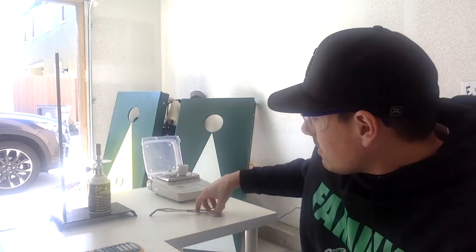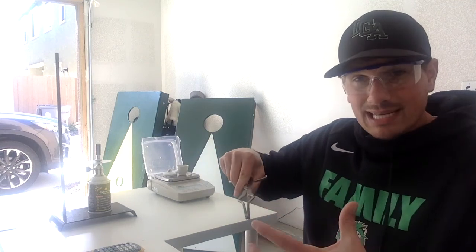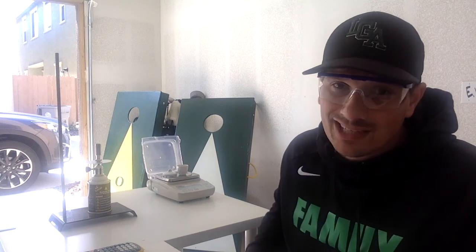So I'm going to set up my burner right here. I forgot a ring stand, so I'm going to hold the crucible that's going to burn the magnesium over the flame. Hopefully after a couple minutes this thing lights on fire. It's going to look like a flare, so don't look directly at the flame. And then we're going to do some calculations. Otherwise, that's all I have for you.